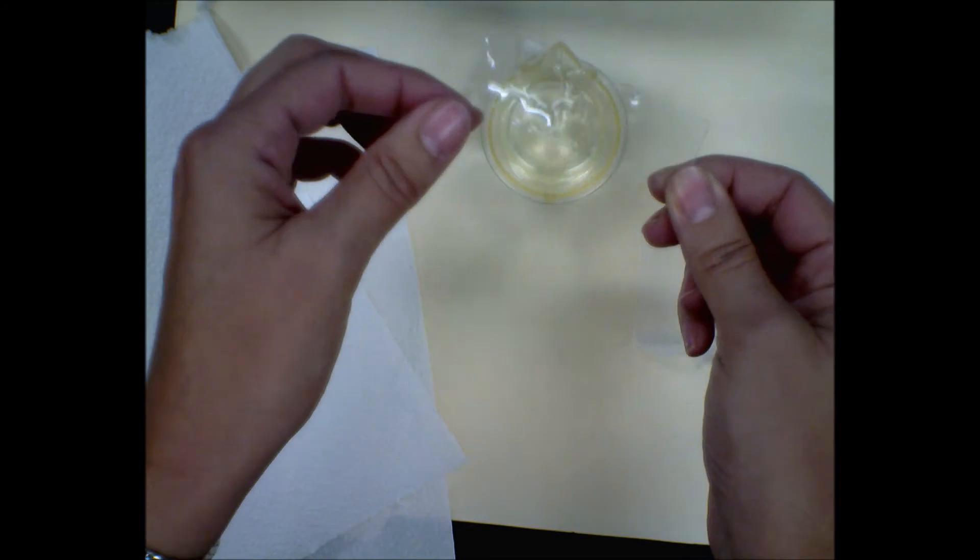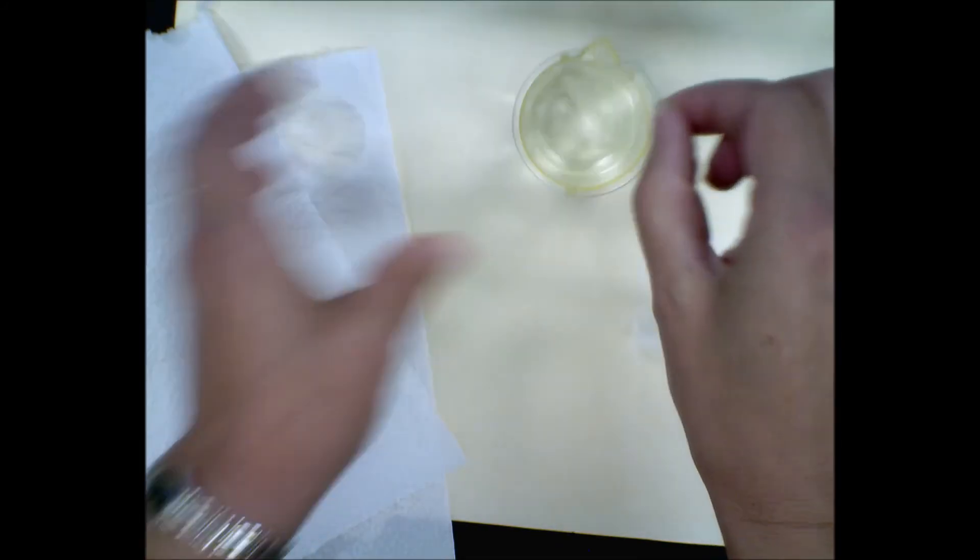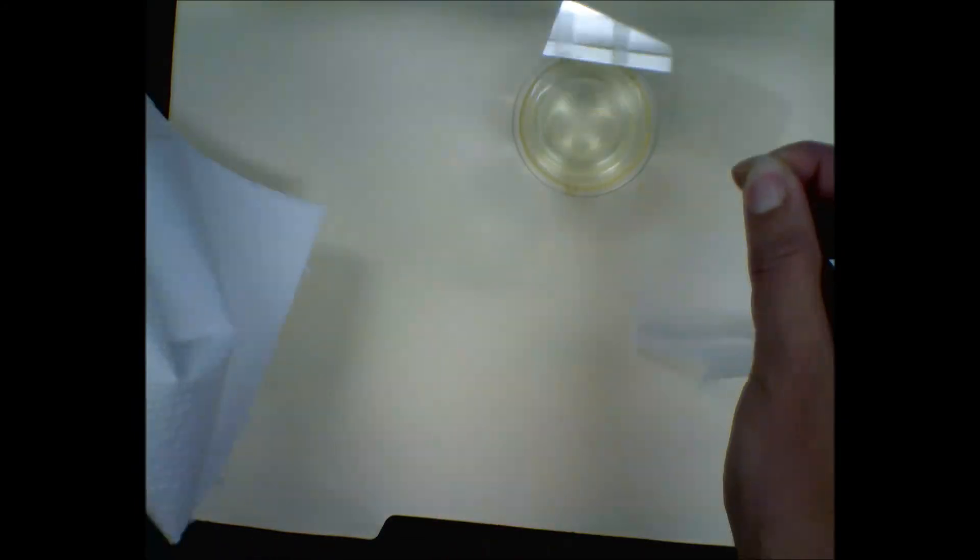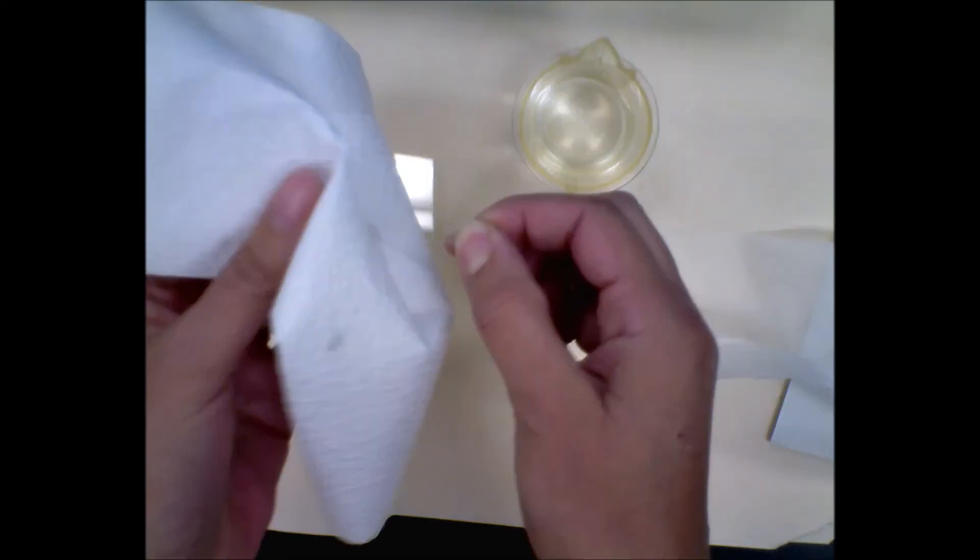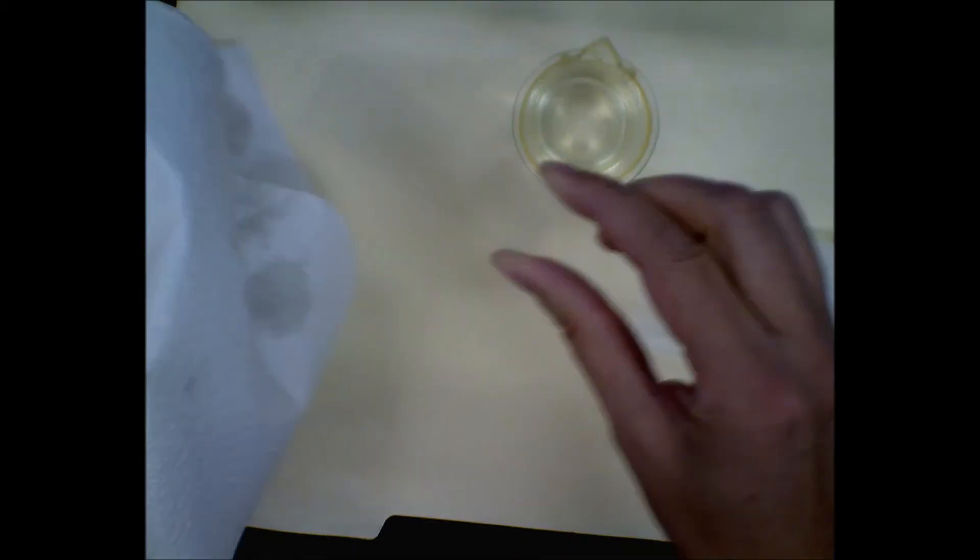Okay, I'm going to dip both sides. Get all the slide wet. Again, use a paper towel to get most of the gunk off. Hold it up to the light if you need to, and make sure you have everything. Notice I'm hanging on to it by a corner. Very rarely will you be looking at a corner, so it's okay to hang on to it by the corner. If you're really talented, do the edge.